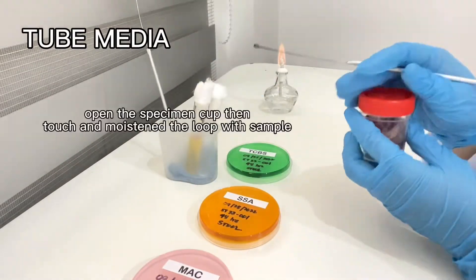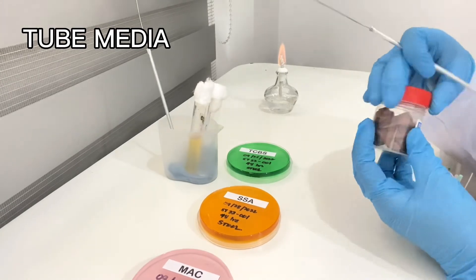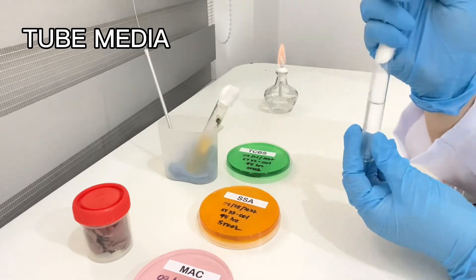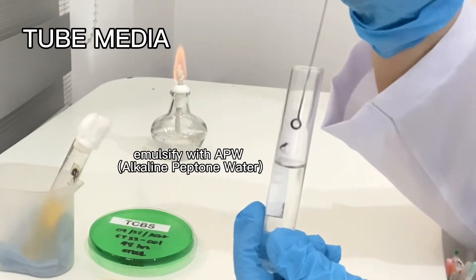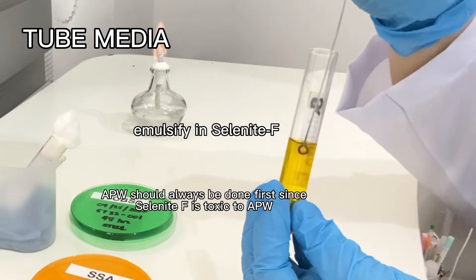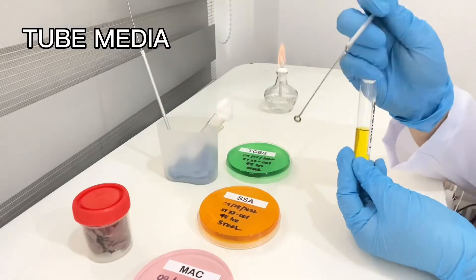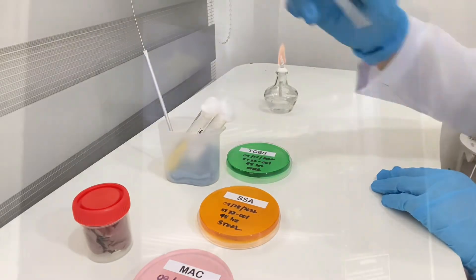For the tube media, open the specimen cup and moisten the loop with the sample. Then emulsify the sample with APW; only the loop must be dipped in the tube media. Followed by the Selenite F — again emulsify. APW should always be done first since Selenite F is toxic to alkaline peptone water.